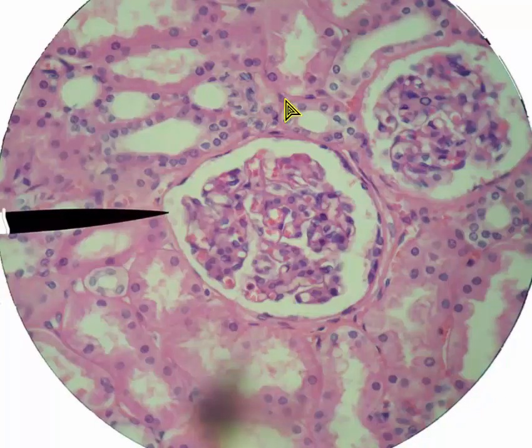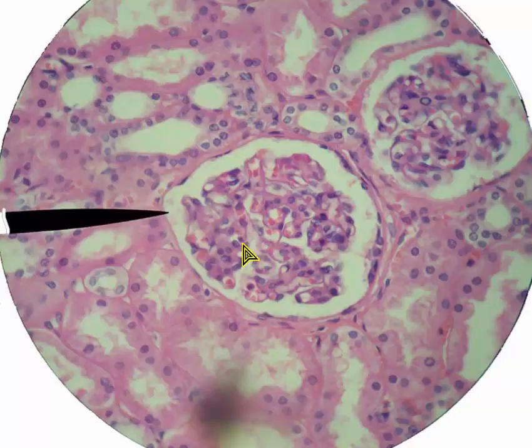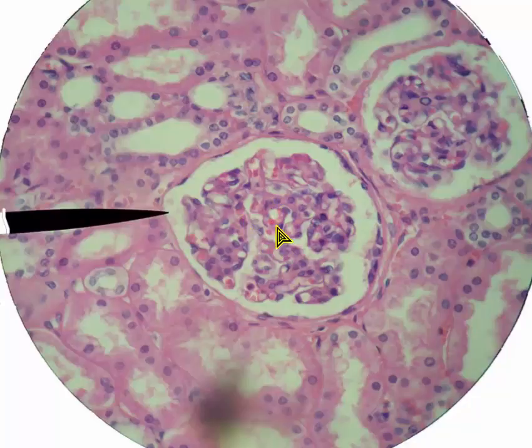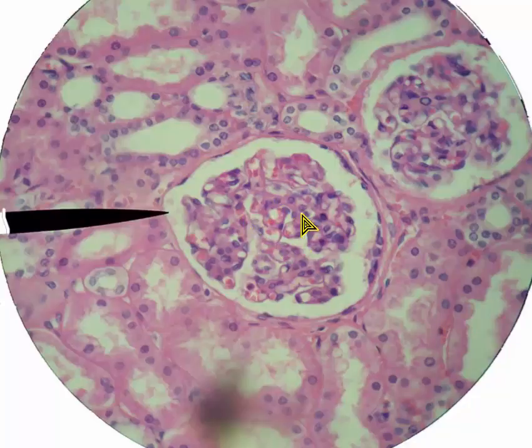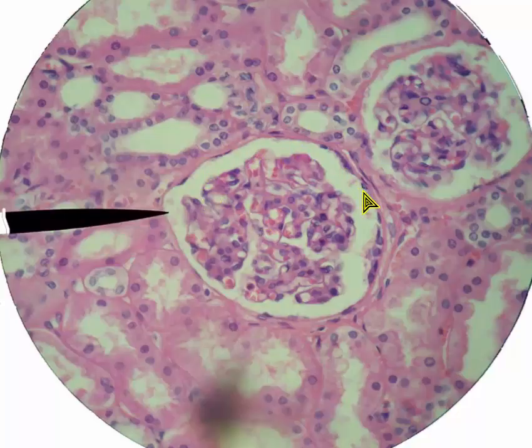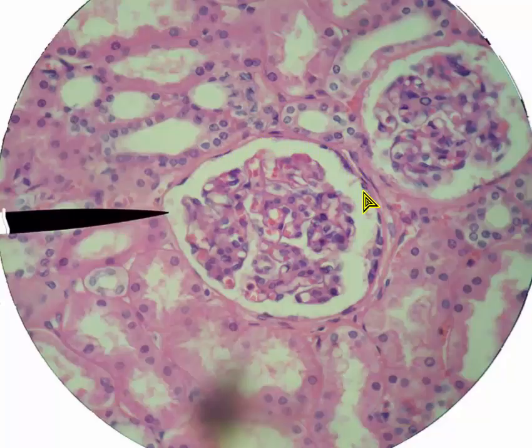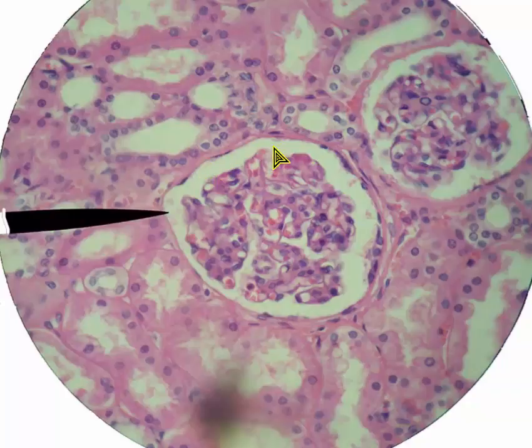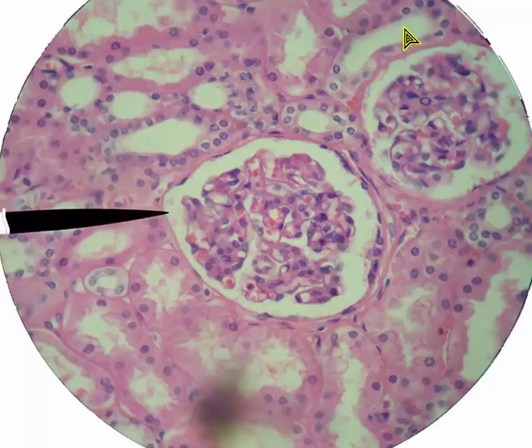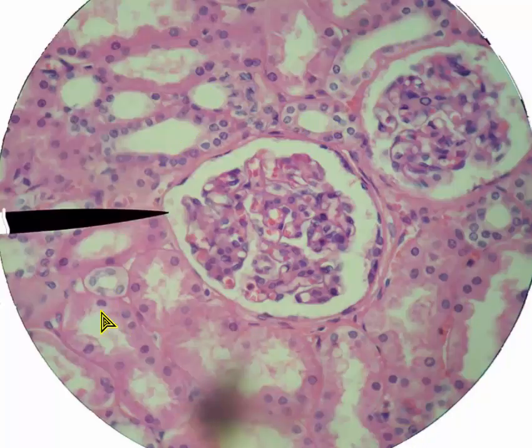This is 450 times magnification. Here's that renal corpuscle, nicely magnified so that we can make out the two major parts. Inside would be the glomerulus or glomerular capillaries. Then the space here and the covering around it — that is the Bowman's capsule or glomerular capsule. And then here we see renal tubules all over the place.